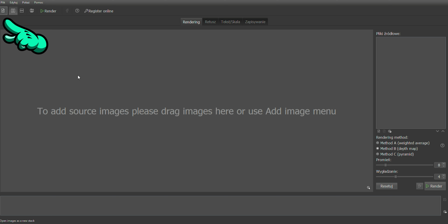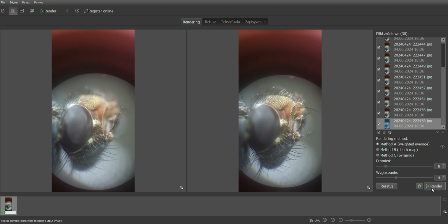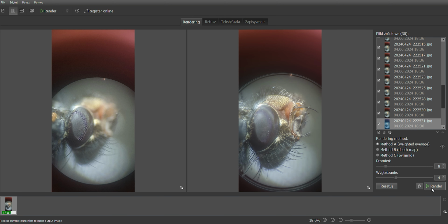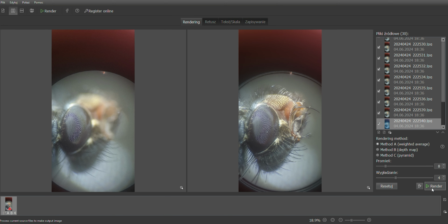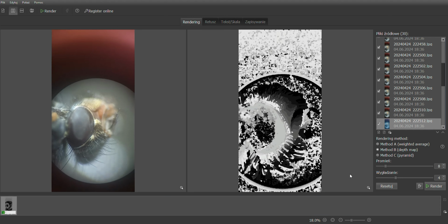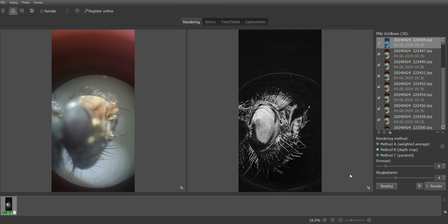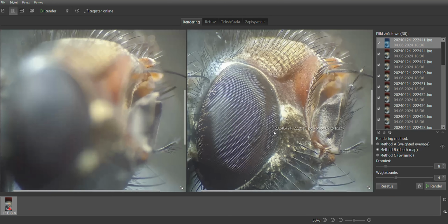After uploading the photos we want to use, we need to choose one of the stacking methods. Method A creates a weighted average of pixels based on contrast. I use it less often, but it's the best for preserving natural color and contrast. Method B is the one I use the most. It selects the sharpest pixels and builds a depth map. It requires the images to be taken in order, meaning the focus point needs to move gradually across the frame.